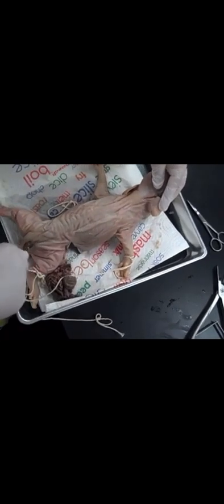Once you have fully exposed the skull, make another incision on either side of the backbone. Cut all the way down until you reach the tail on both sides. After that, start peeling off the skin from inferior to the skull. This area has a lot of meat, so make sure to cut deep enough so that you will expose the backbone.